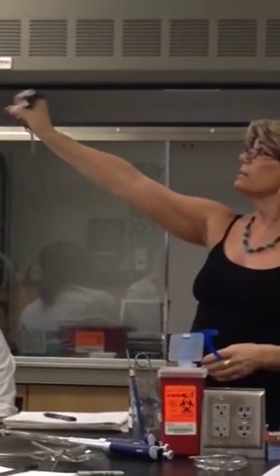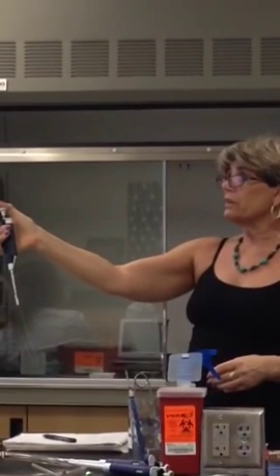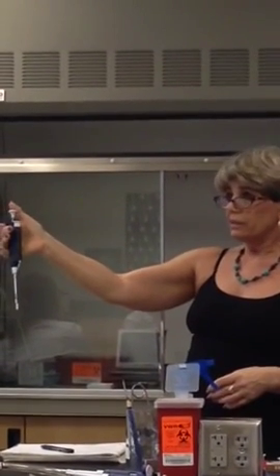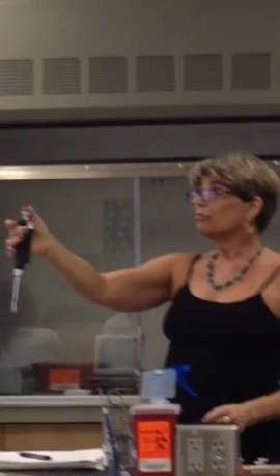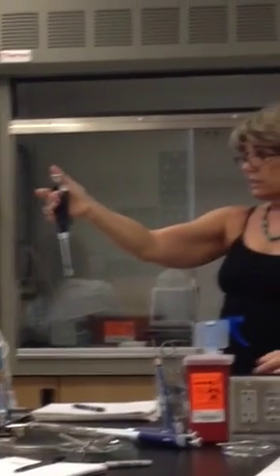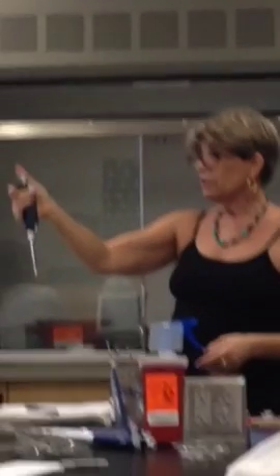Okie dokie. I just want you to hold it like this. And then use your thumb to feel the top. There's a soft stop. You can press it gently. Anita, this would be gentle. No, I know. Press it gently and release it. Another option is press it gentle and then continue to press. That's your hard stop. So you have soft stop, hard stop.